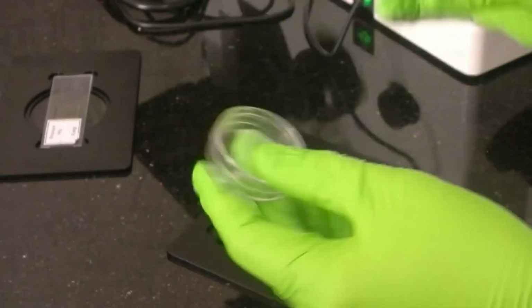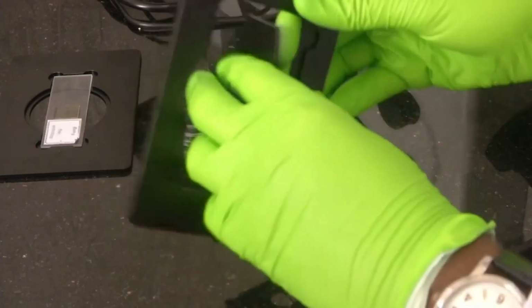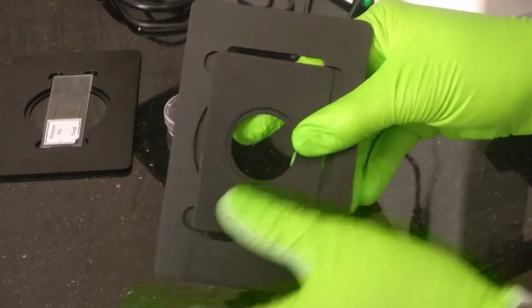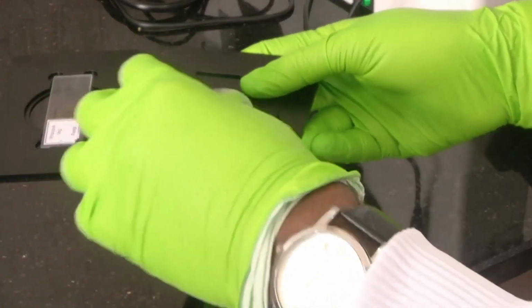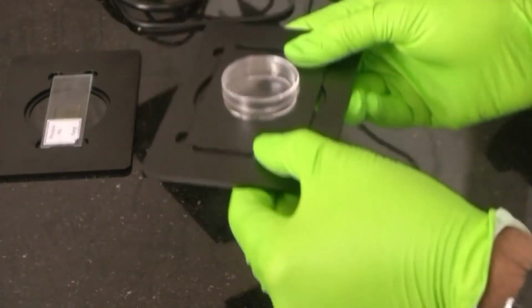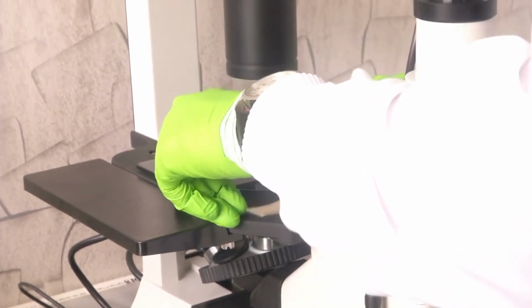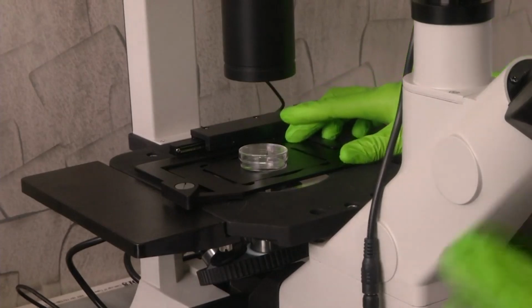So, now where did we start? We told you about this sample holder, right? This is for putting bigger glass slides. If you insert this small sample holder into it, it will become another sample holder basically, to which we can actually put this 35 mm dish. Then it will nicely come and sit there. See, now you can put it and examine your samples properly. This is how the sample holders are important.